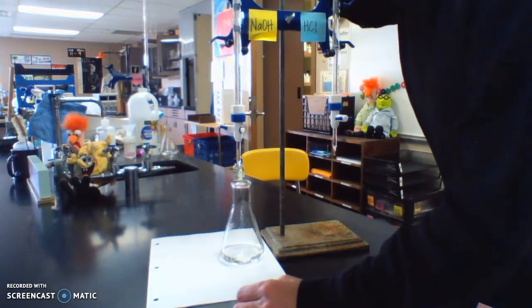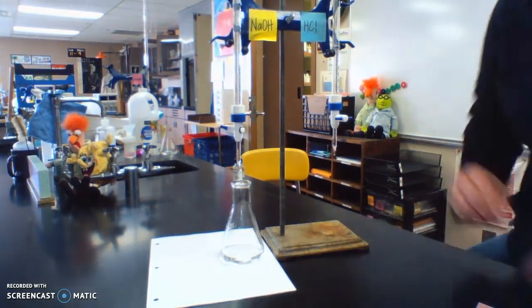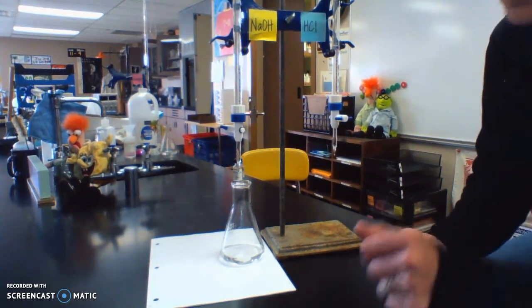And our base is going to be 19 point, I'm going to say 71. 19.71. Okay, so that is part 1.